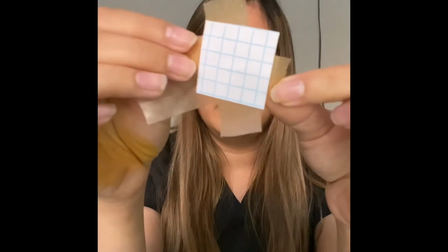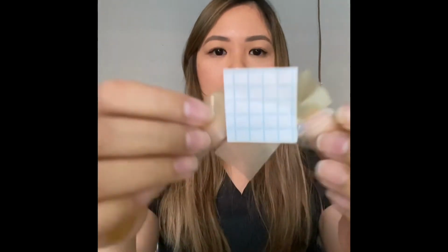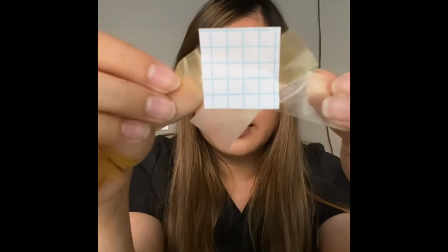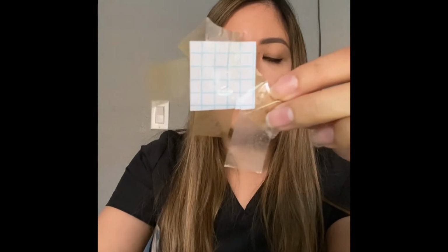Here is this for my forearm, my thigh, and my foot. So yeah, I didn't sweat much, which is normal. I don't think I sweat much normally anyways.